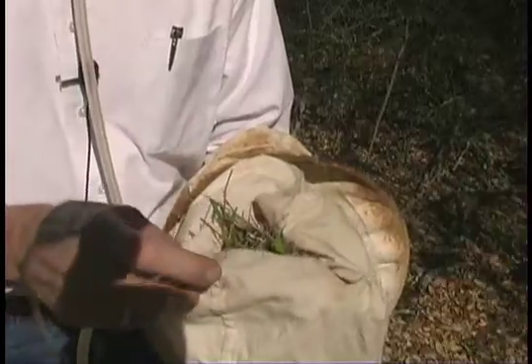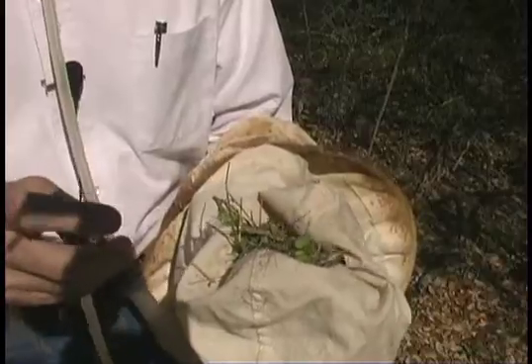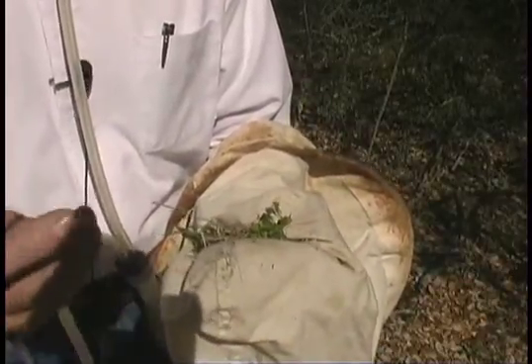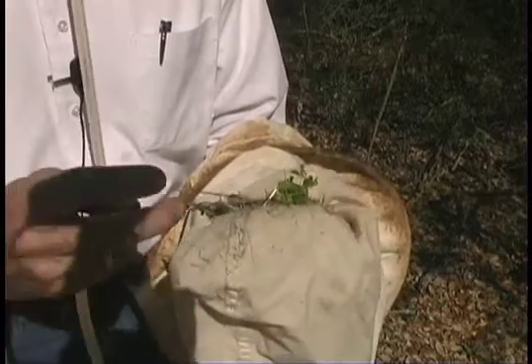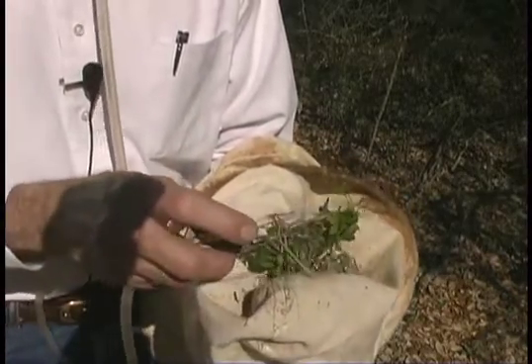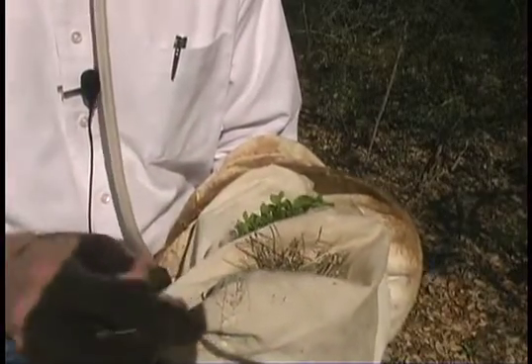Generally, I don't pick up small soft-bodied insects — they're normally hard-bodied, which allows me to freeze the insects in the aspirator. I put the aspirator with the insects inside of it in the freezer and leave it for several hours to allow everything to be killed by the freeze.